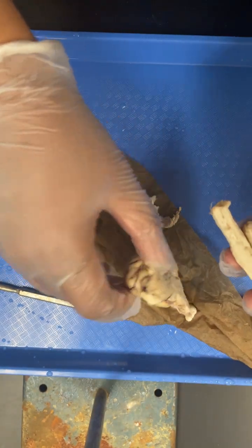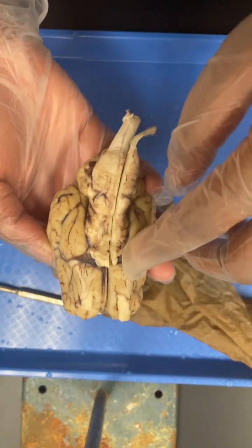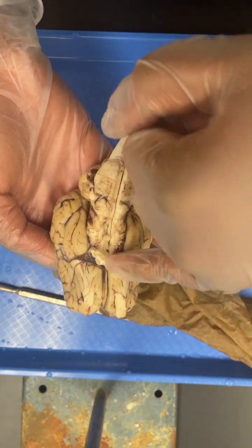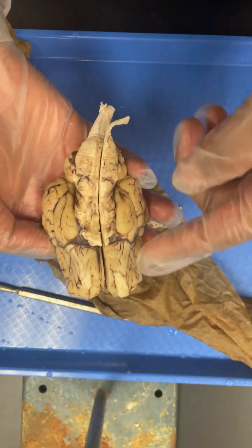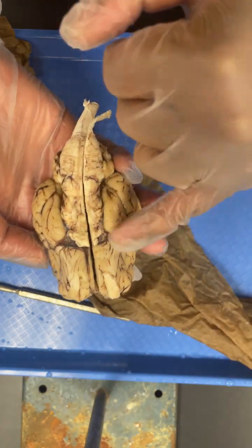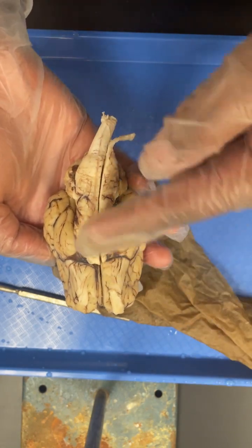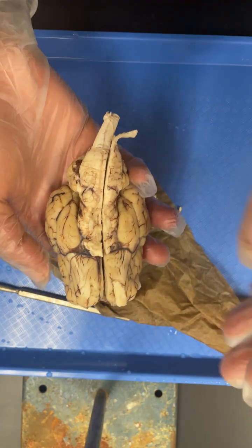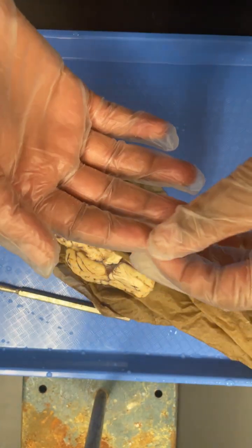And then if you put the two halves of the brain back together, and then you look on the bottom, the optic nerve would come out of the front here, and they would connect, and then you can kind of see where they would connect to the eyes, which would be on either side of the skull here and here, and then they feed into the optic chiasma, which is this crisscross structure here, and then go back to the occipital lobe, where they would be processed.